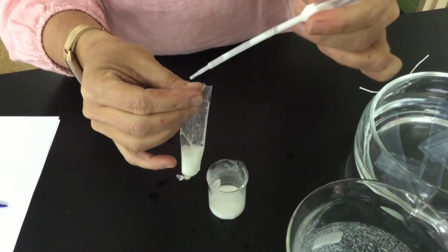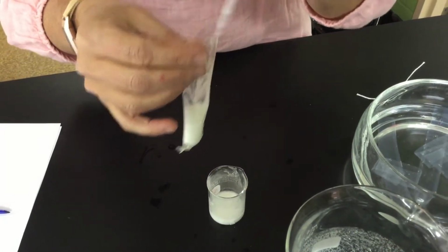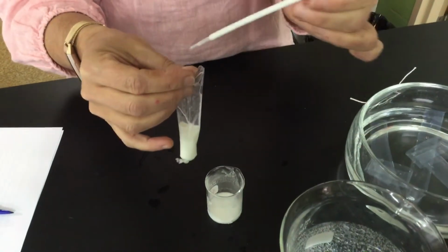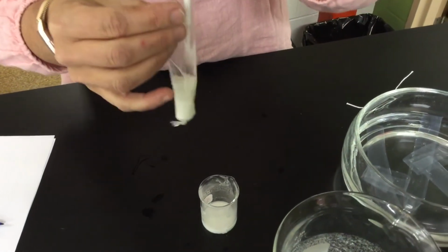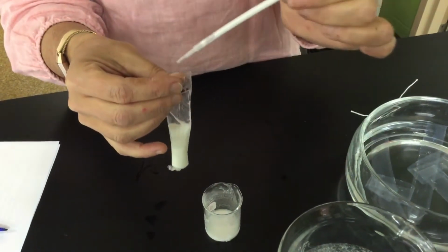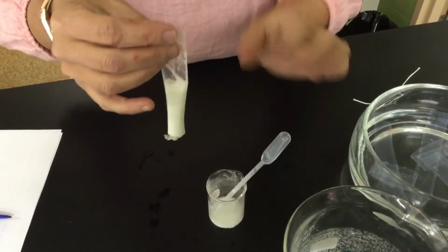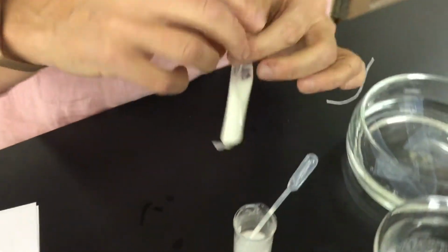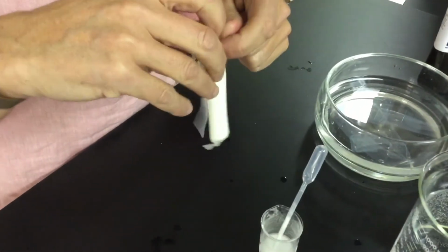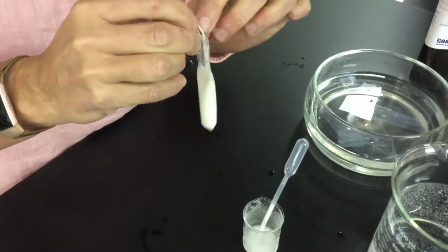What we're going to be looking at is to see how things are able to move. If you remember from our organic chemistry section, we talked about indicators. We said Benedict solution would test for sugars. We're actually going to use a test strip today, so we don't have to pour Benedict solution in it. But we also said iodine would be your indicator for starch, and when iodine comes in contact with starch, you guys remember, it changes from an orangey brown color to more of a purple color.